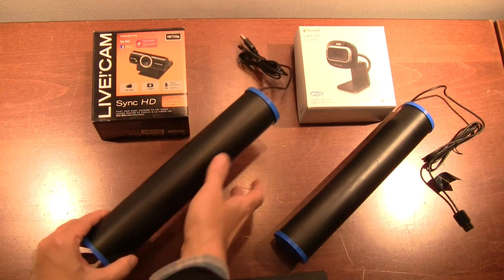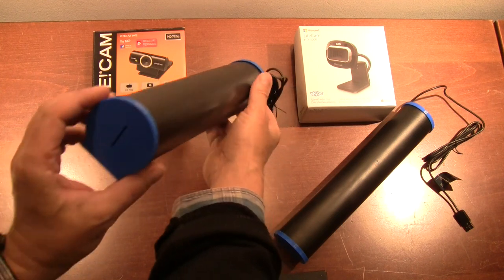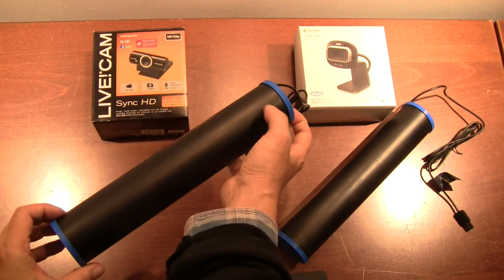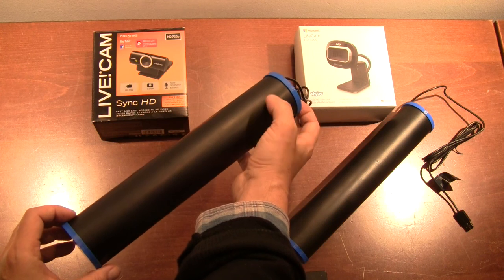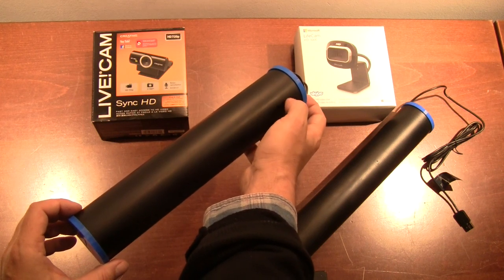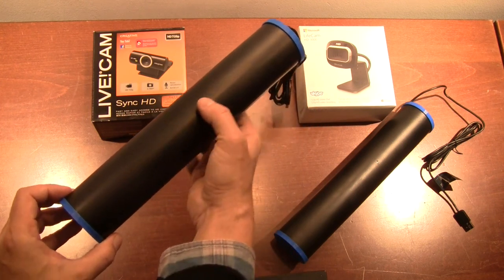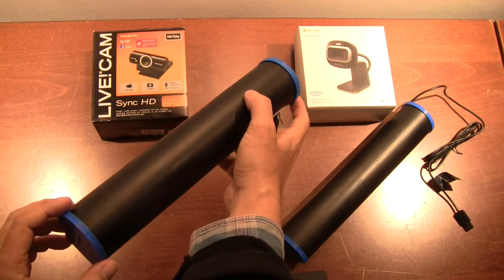You have a long tube which has a webcam mounted at the far end, and it has a slit entrance at the front to allow the light to come in. And the webcam is at an angle of maybe 30 to 45 degrees and also has a diffraction grating of about 1,000 lines per millimeter, which sits in front of it to create the spectrum. And it also uses a diaphragm internally, which helps prevent glare between the entrance and the webcam.